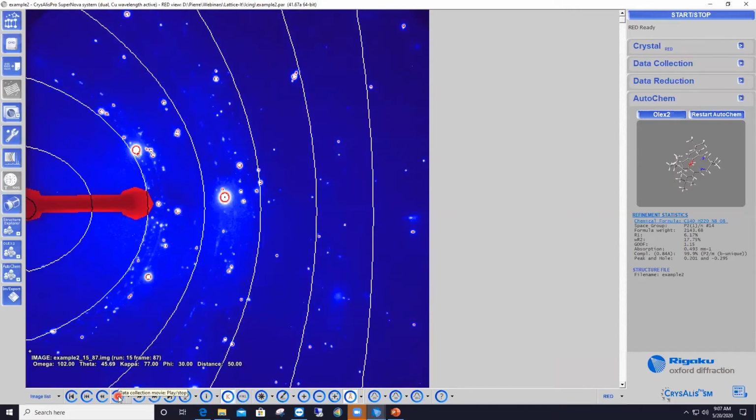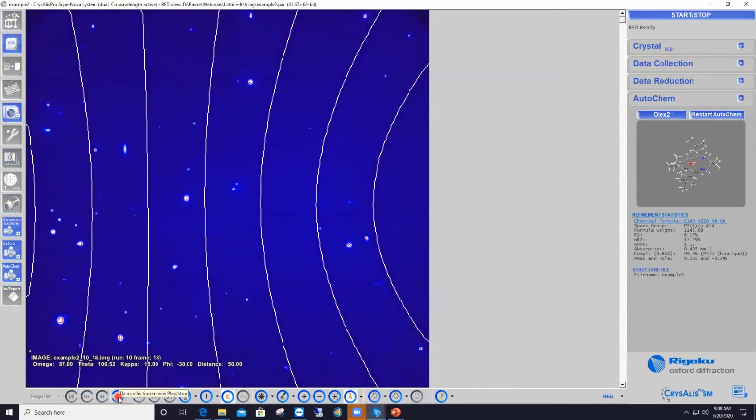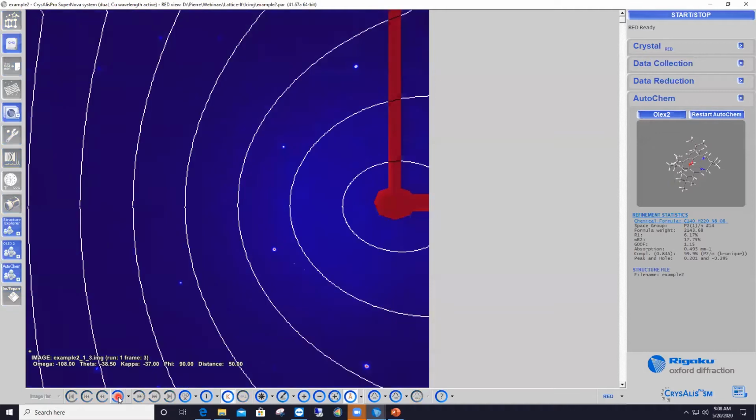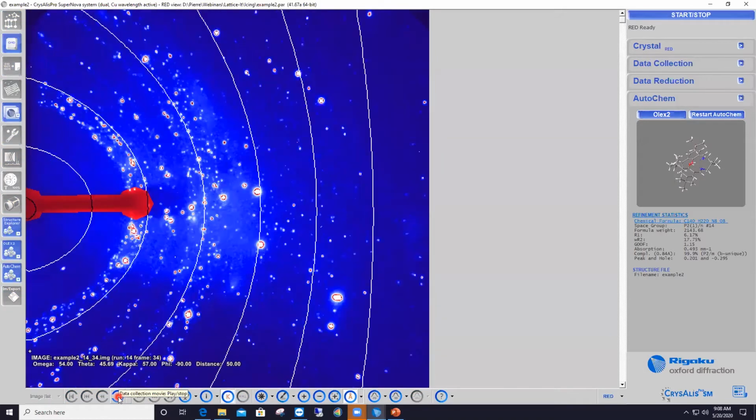I'm going to play that dataset a couple more times so that you can see that at the beginning, on that first diffraction image, everything is clean. There is no trace of ice features. If I play the dataset as a movie, the data are clean for a while, then ice starts appearing, and then at the end, it becomes really bad. Let me play it once more for you. Clean. Ice starts appearing, and at the end it's really bad.